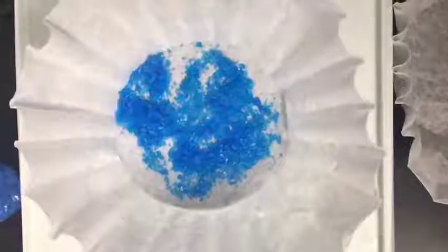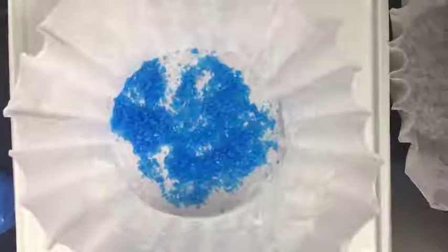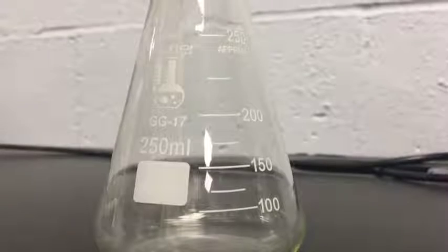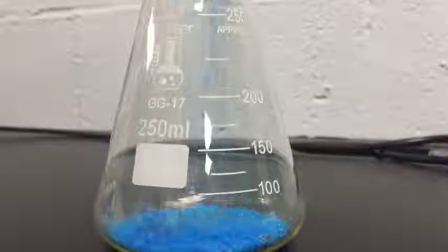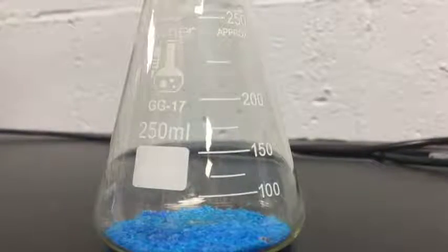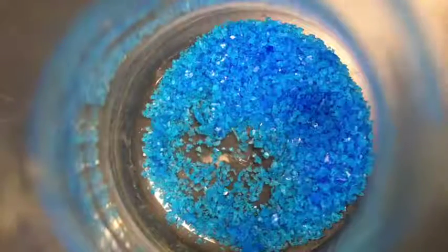Alright, so first up, you'll plug in your hot plate and you'll make sure it's heated up to about 250. You can see me turning the knob there, and this would be in degrees Fahrenheit. Next, you're going to weigh your Erlenmeyer flask, and our flask weighs about 110.129 grams, and you'll want to write that down. Okay, so we'll take 10 grams, which in our case, we measured about 10.6 grams of copper sulfate, and we put it in the Erlenmeyer flask.